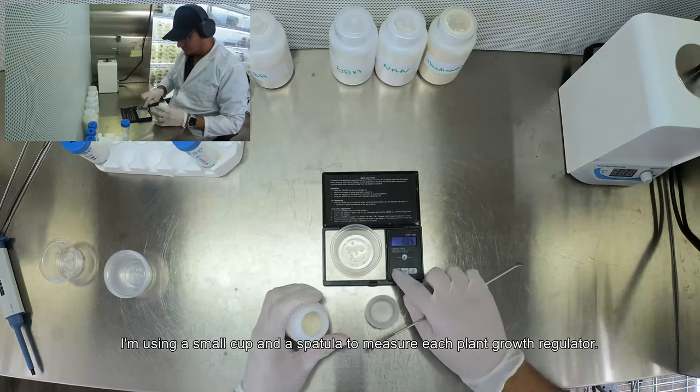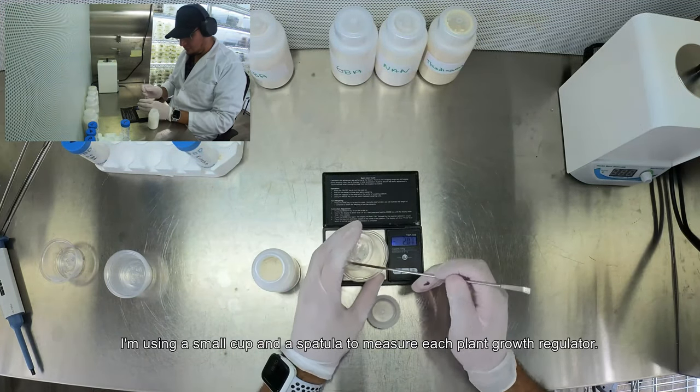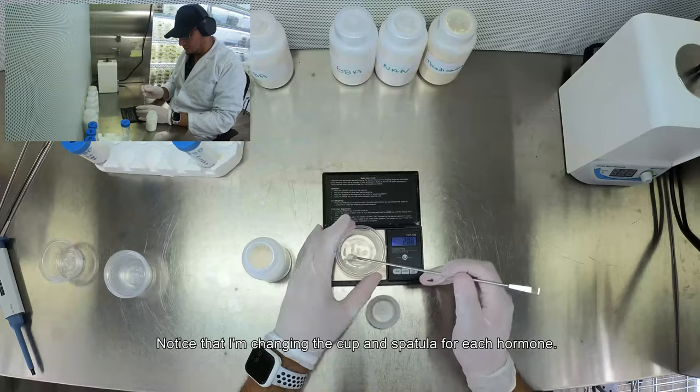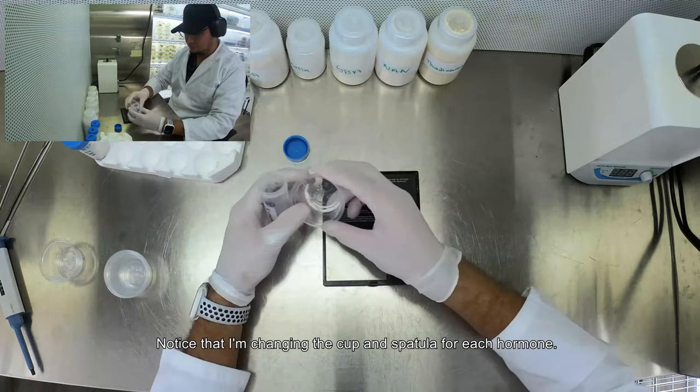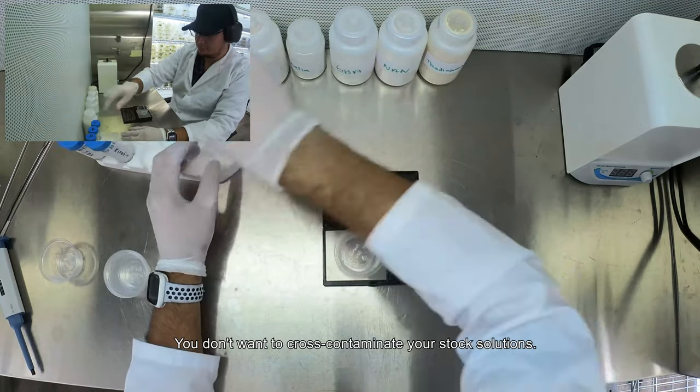I'm using a small cup and a spatula to measure each plant growth regulator. Notice that I'm changing the cup and spatula for each hormone. You don't want to cross-contaminate your stock solutions.